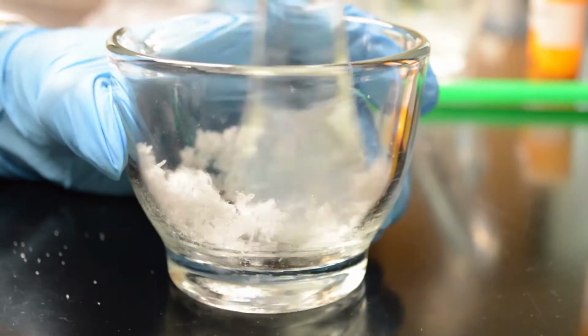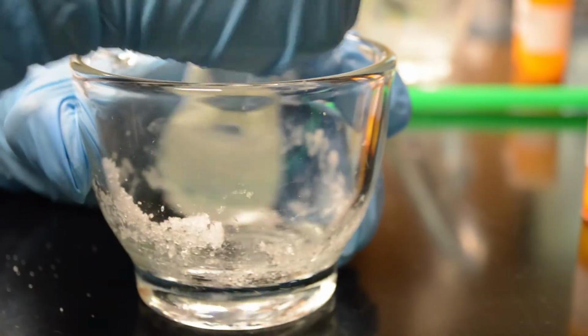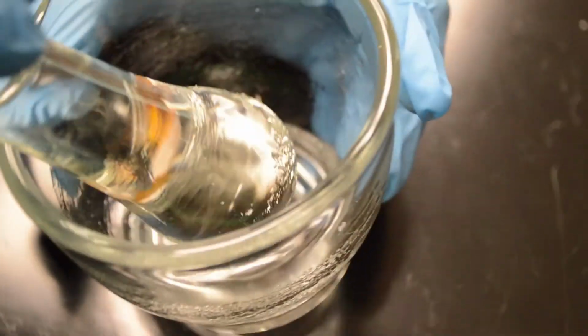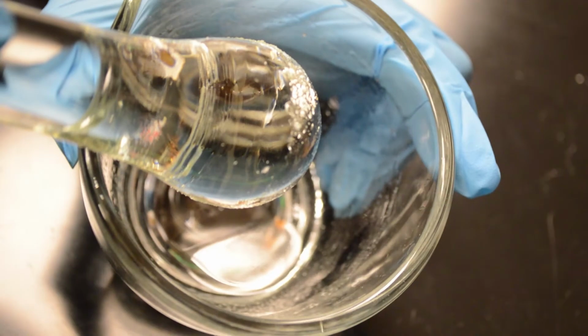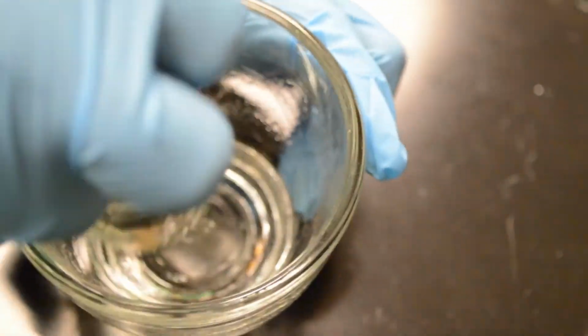So remember, eutectics have to be forcefully mixed. You have to make an intimate mixture by forceful trituration of the two ingredients. So what is the final physical state of the product? Liquid. So mixing two solids, we are getting a eutectic liquid mixture.